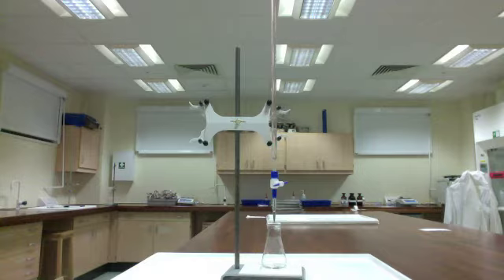Sodium hydroxide is so reactive that it reacts with the water vapor in the air, so while we're weighing it to get the mass we need, it actually increases in mass as it reacts with that water in the air. For that reason, we can't get a solution that has a super accurate, precise, known concentration. So we have to undergo this process by titration, which is called standardization.